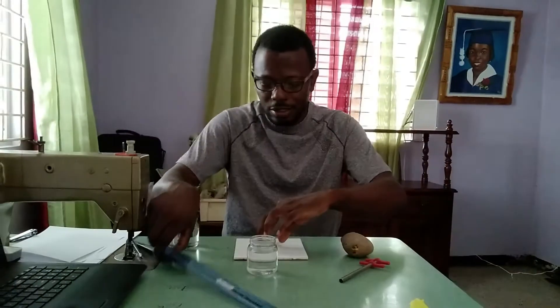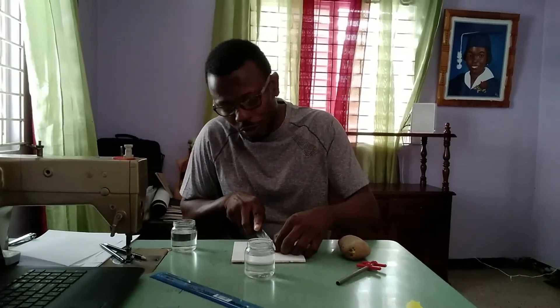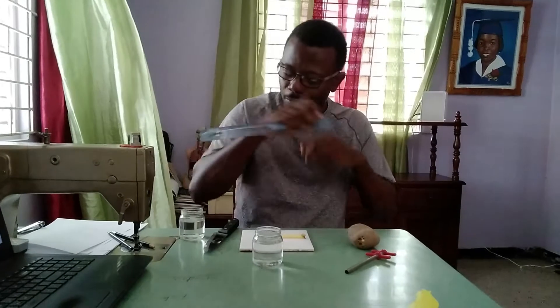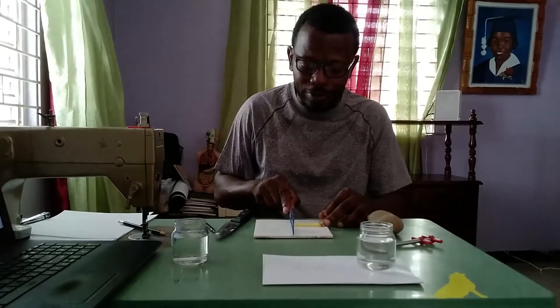We get the second core out — good. We could just pull it out or shove it out the same way. I have no predetermined length, so I'll just use a workable length here. We're going to cut off the end to ensure it is even, then line them up. We need to know which sample is the salt solution, so I'm going to label it 'salt.' Always remember to label — label, label, label — if you don't label you could find yourself in serious problems. The other one I'm labeling H2O.